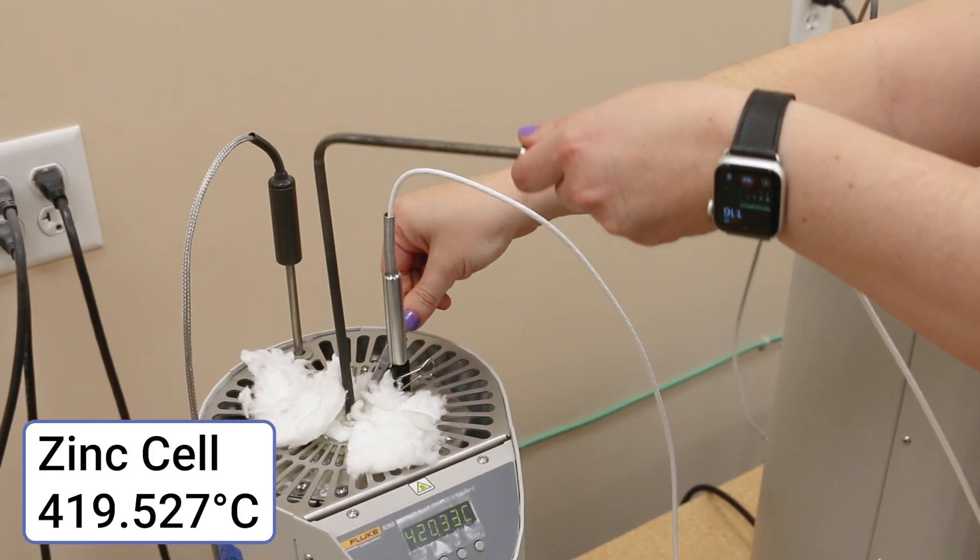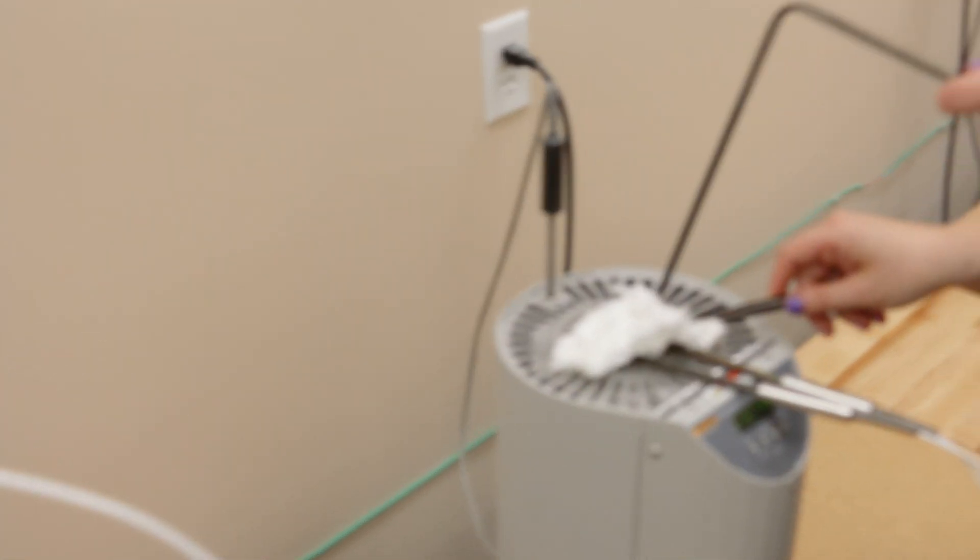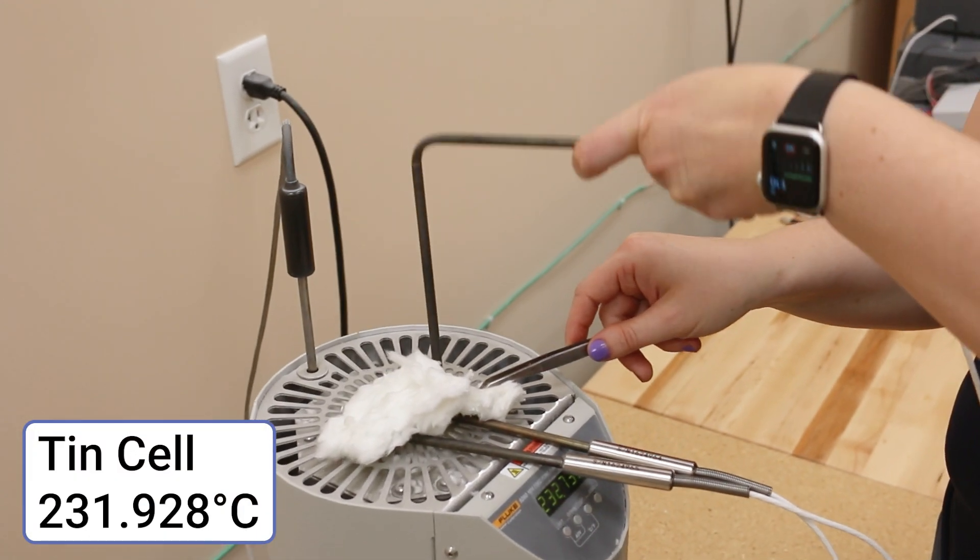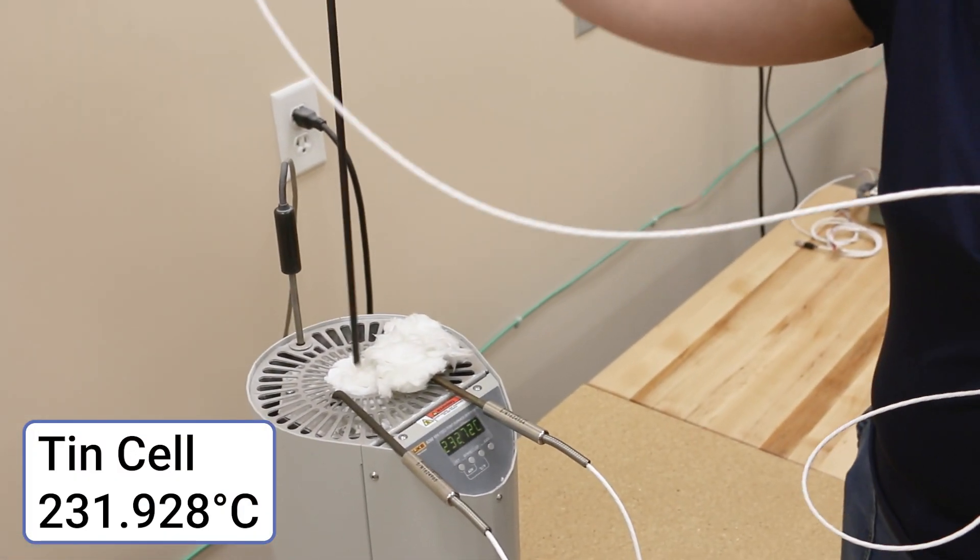After measurement, the probes can be moved directly into the preheat well in the tin cell furnace to further reduce downtime. At any time, we can check the temperature of the tin cell as well.